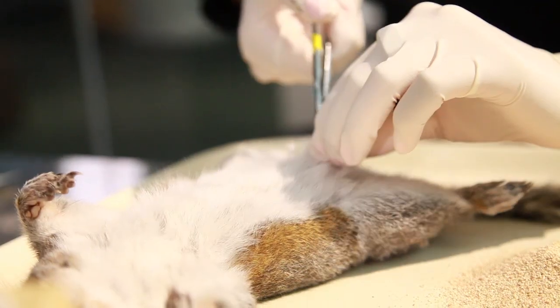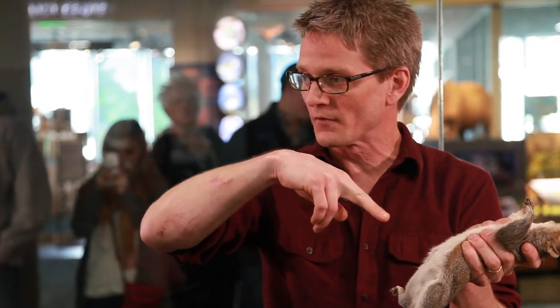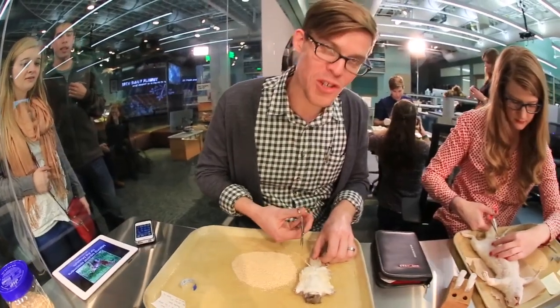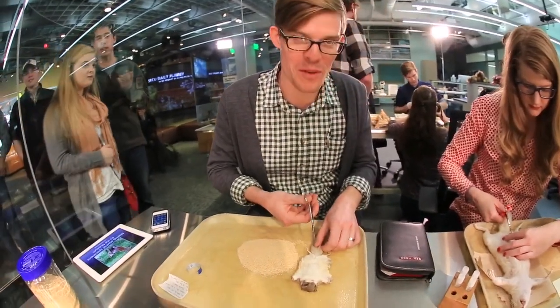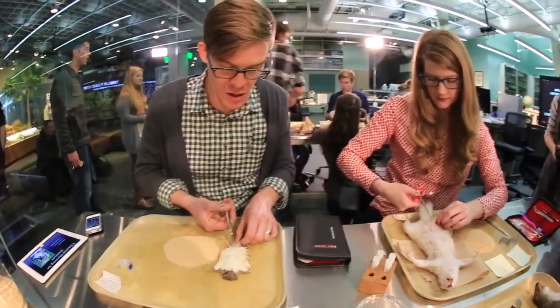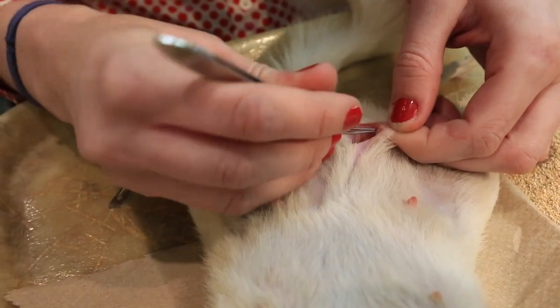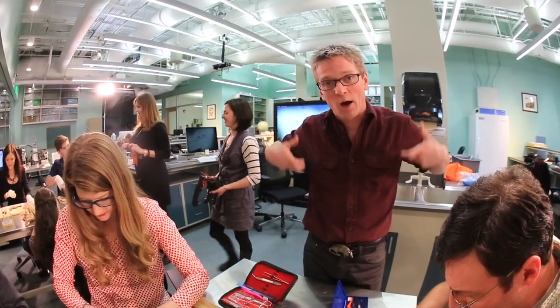From there, you've got to cut a hole in the belly, right here — just enough that you can get the skin and start pulling it off. Usually if you pinch it up, you make a small cut sideways, and then cut up the sides. So we're making our initial incision from around here to around here, through the soft part of the belly.